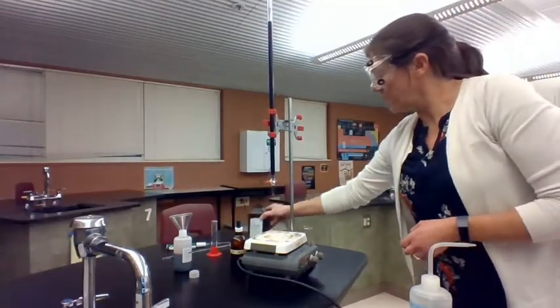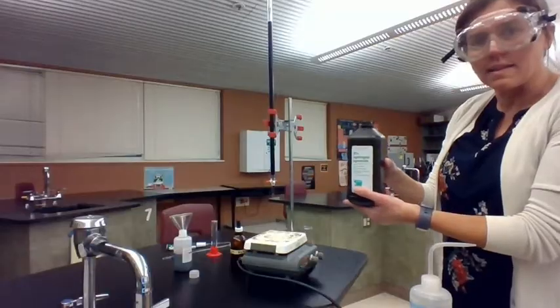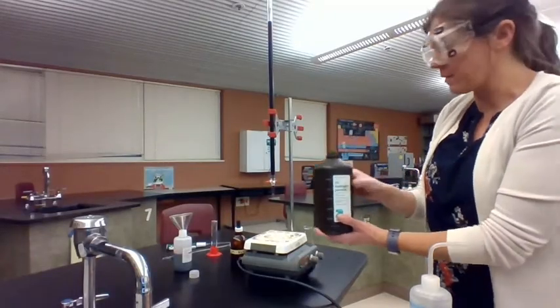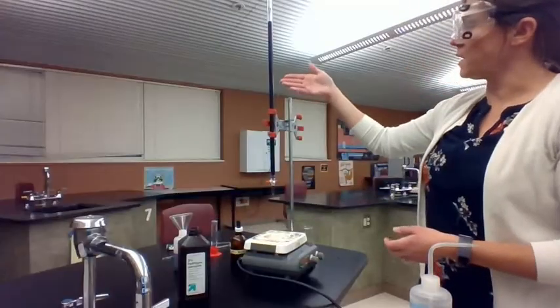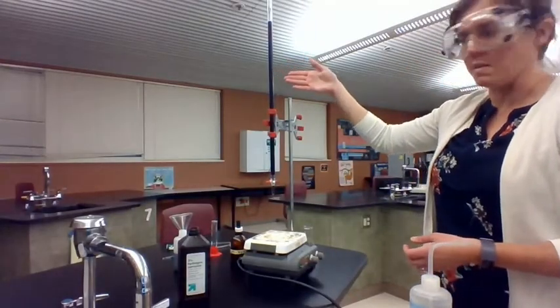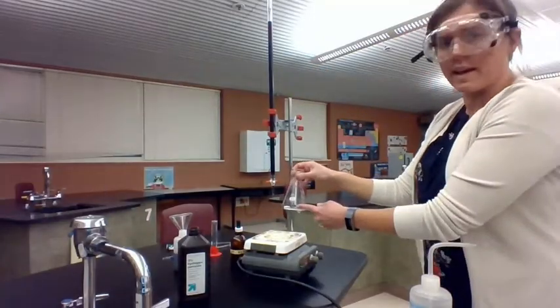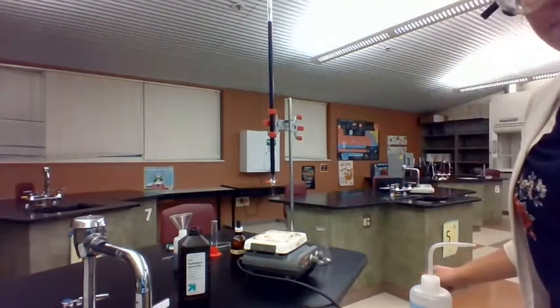We are going to be titrating some hydrogen peroxide — this is going to be our unknown solution. We're trying to figure out the molarity of our hydrogen peroxide, and we are titrating it with potassium permanganate, which is this purple solution that is in the burette. So we're going to have hydrogen peroxide in our flask and potassium permanganate in our burette.